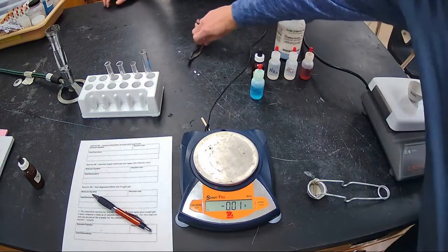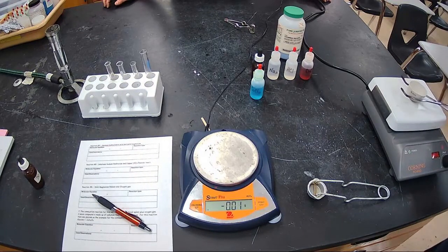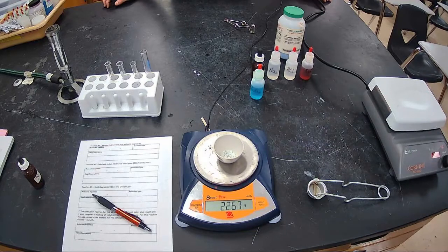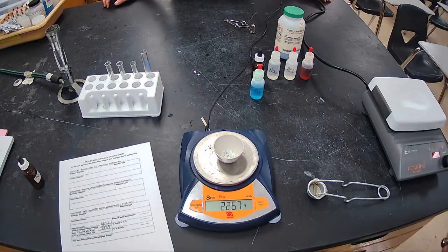So we've gone a little bit past the 8-minute mark. We're actually at 11 minutes, which isn't a bad thing, but we can see, has this changed at all? And get our next mass. What was it last time? Seems a little lighter, doesn't it? It was 22.67. So I think that we got the first time.